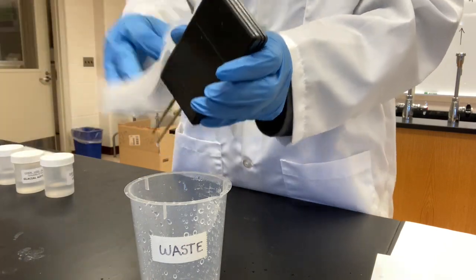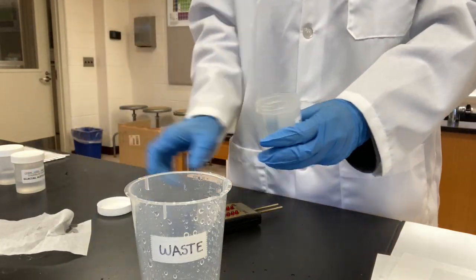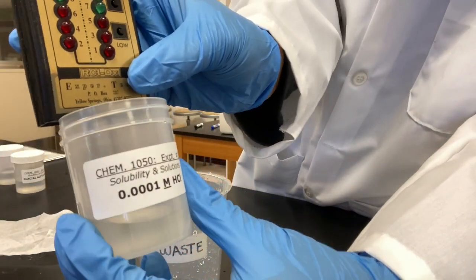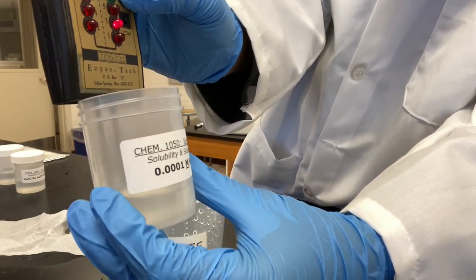Next, we're almost done. Next, 0.0001 HCl. Let's go high 3.